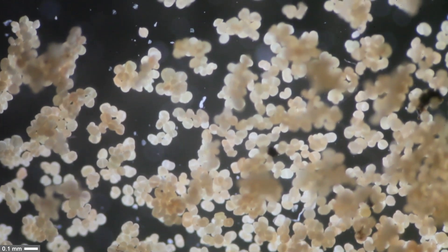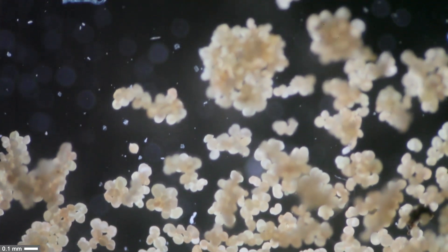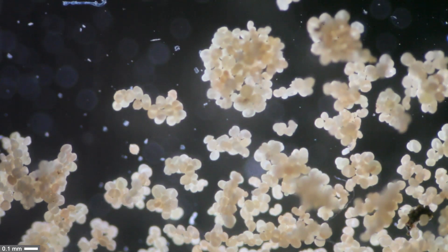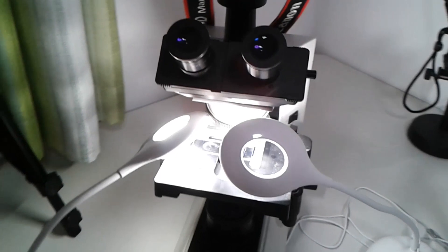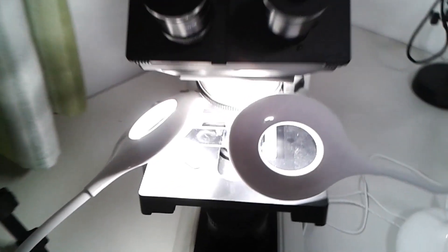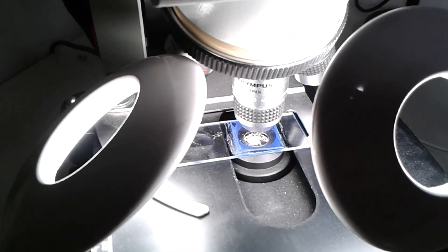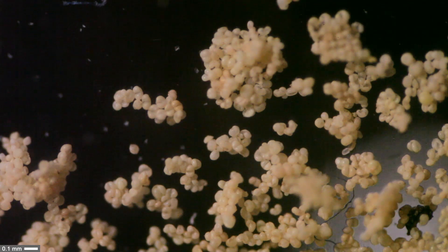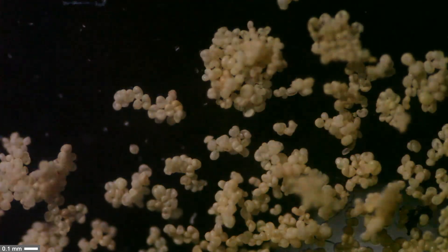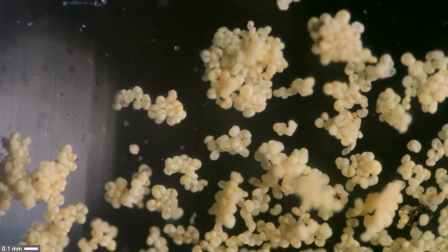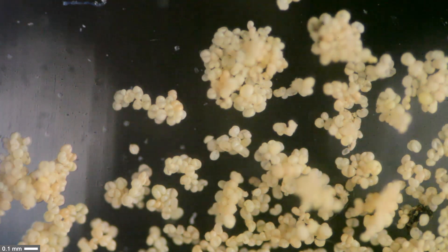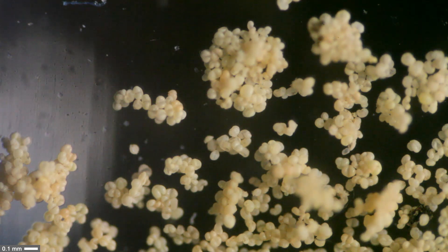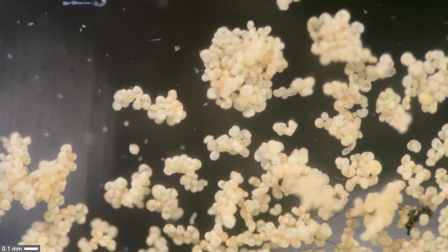Using the 4x objective, I switched off the microscope light and used my desk lights for top illumination. Now it looks like a stereo microscope. I'm adding a second lamp and you can see it almost looks three-dimensional because the light is coming from the top.